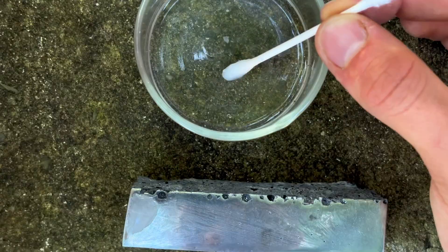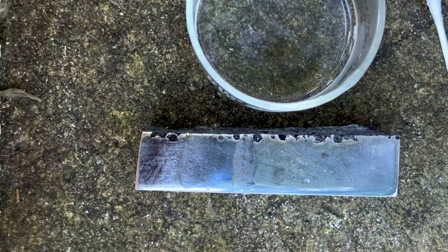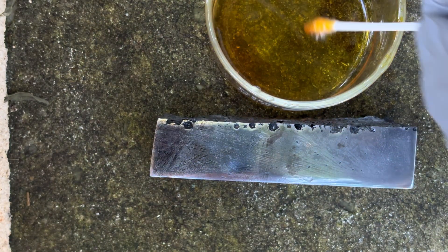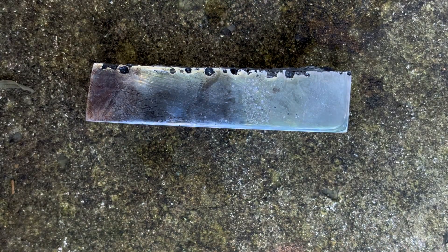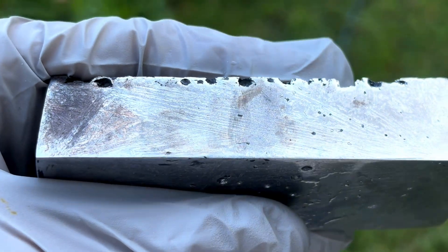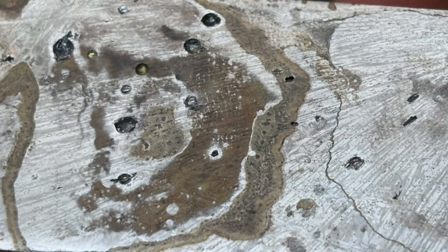Once everything was polished, I tried etching with a pretty large variety of different chemicals, all in different concentrations: hydrochloric acid, nitric acid, sulfuric acid, ferric chloride, and I even threw in glacial acetic acid just because. After this, I tried aggressive bases because the aluminum oxide surface layer is pretty unstable at high pHs. I tried sodium hydroxide, potassium hydroxide, and potassium carbonate, which will actually pop up again in another video. But unfortunately, after trying out these etchants, I saw no success. I even let some of these chemicals sit on the ingot overnight, but even then, pretty bad results.